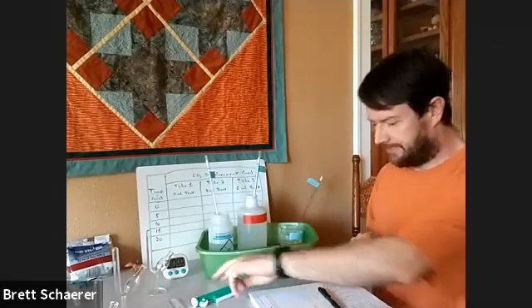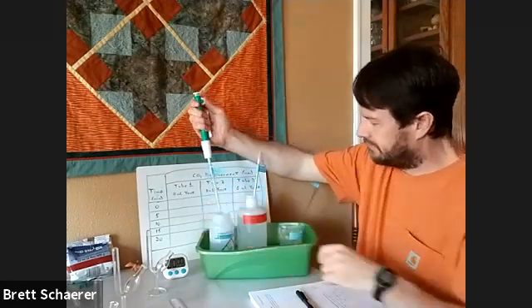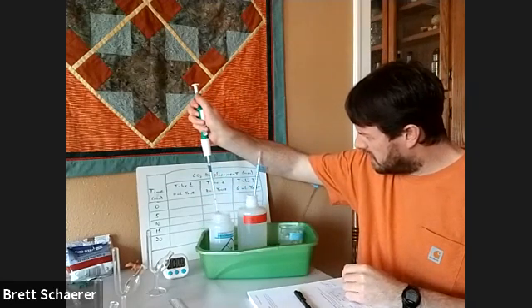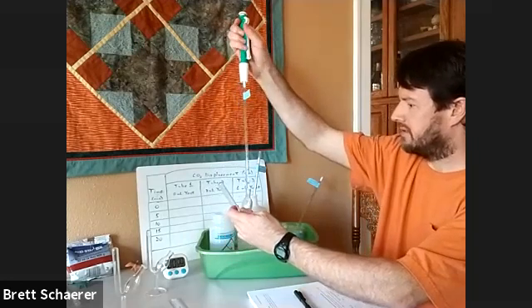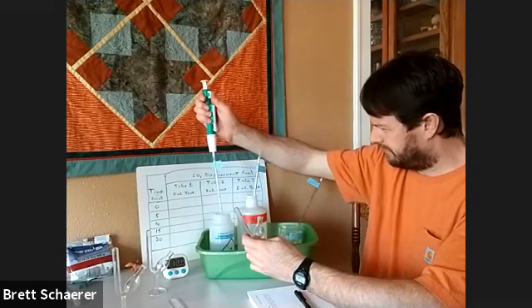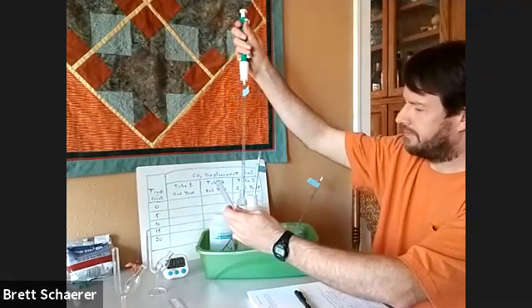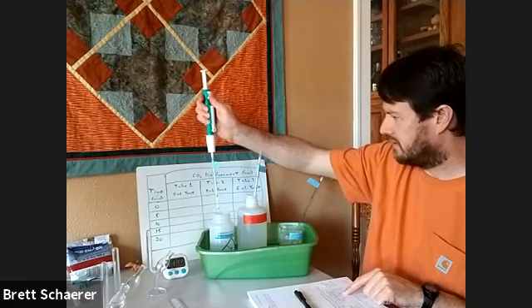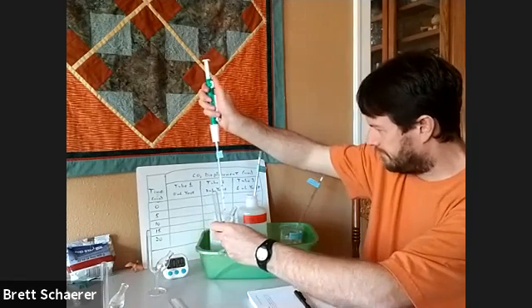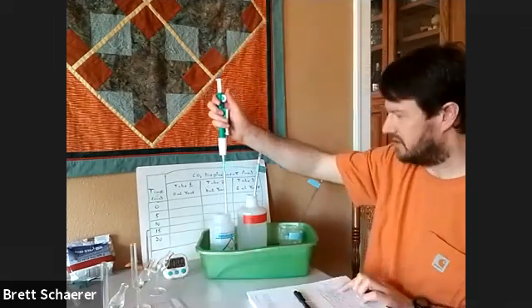I'm going to start filling these with the appropriate solutions. For water, tube one is going to get eight milliliters of water. Tube two is going to get six milliliters of water. Tube three is going to get two milliliters of water.